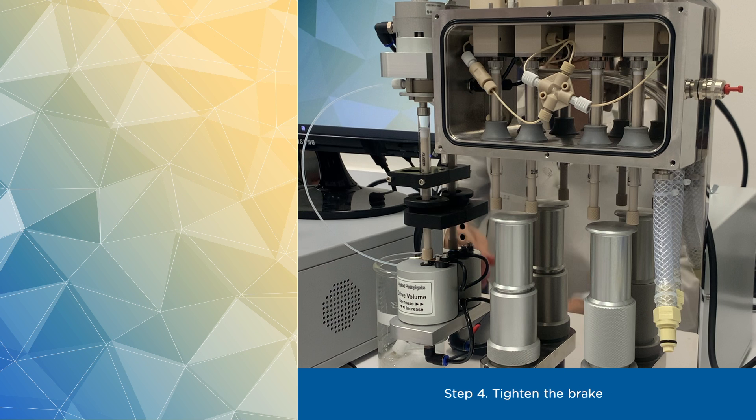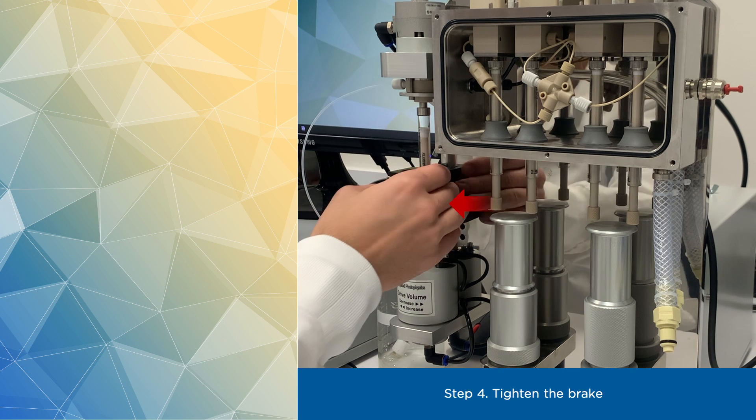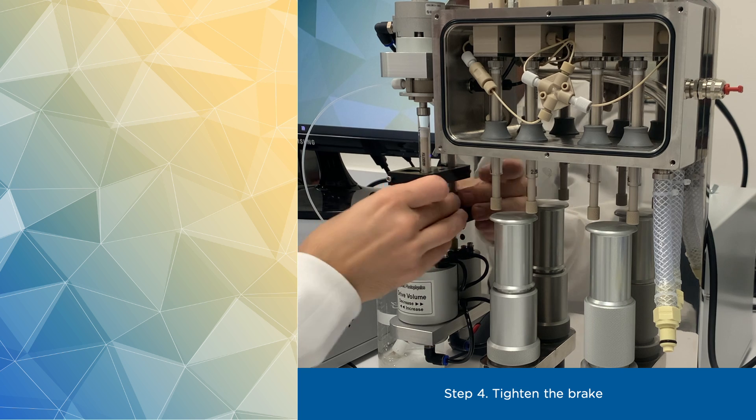After doing that, tighten the brake above the stop syringe to ensure correct pressure differentials between two pneumatically driven rams.